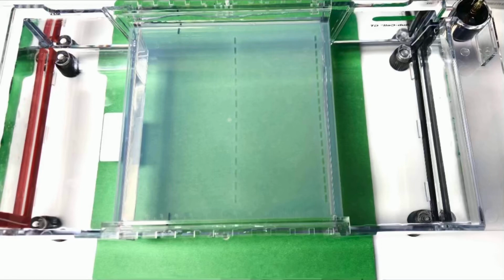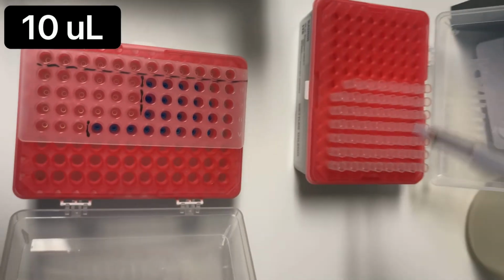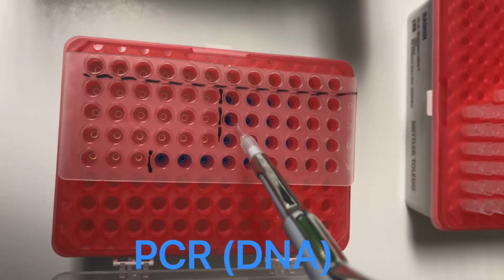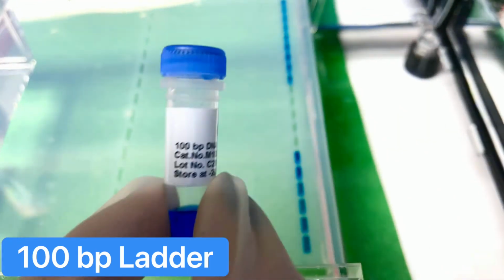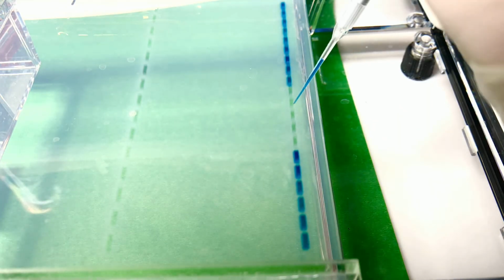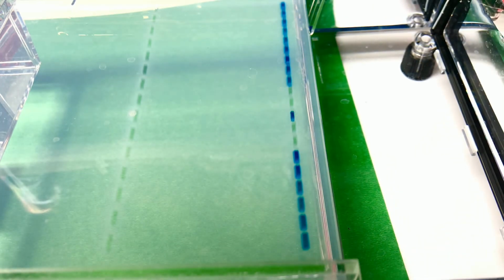Now you are ready to load your gel. Set a pipette to 10 microliters. Pipette up and down in the well to mix. Suck up 10 microliters and gently add it to a well. After you've loaded your samples, you will need to load a ladder. The ladder helps you determine the size of your PCR product and should be loaded on every comb.